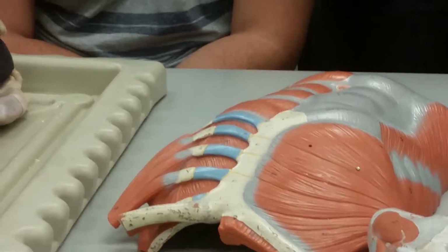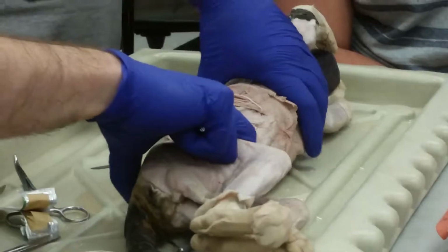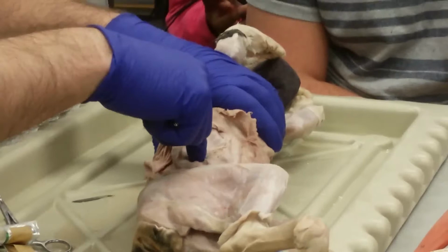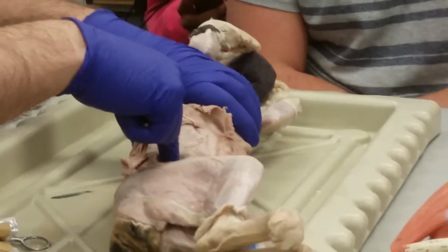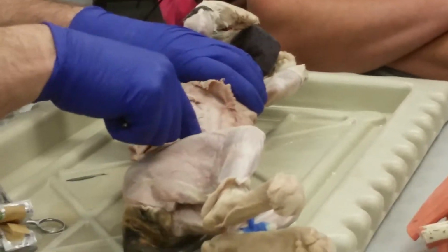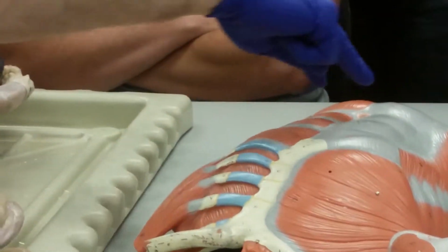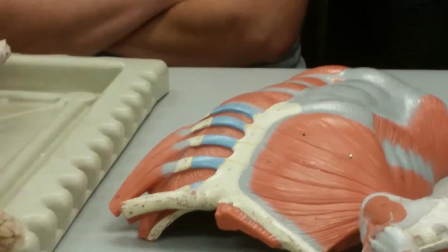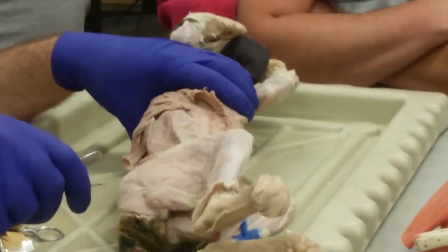Here's the rectus abdominis on the human. Now, internal oblique, it's going to basically do the same thing as the external oblique, except it's pulling this way. So when it rotates, it will rotate towards the same side. Okay, so it'll flex the torso, compress the abdomen, and rotate the torso towards the same side the muscle is on. Rectus abdominis, rectus means along the line up, so it goes right down the line here, between the ribs and the pelvis, so it will only flex the torso and compress the abdomen. It can't rotate. It doesn't have any leverage to rotate.